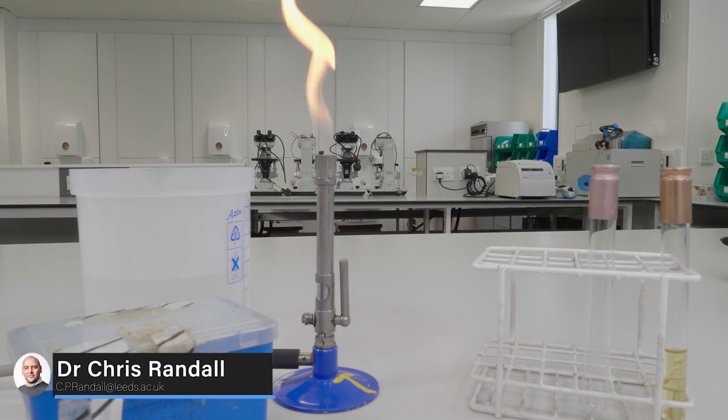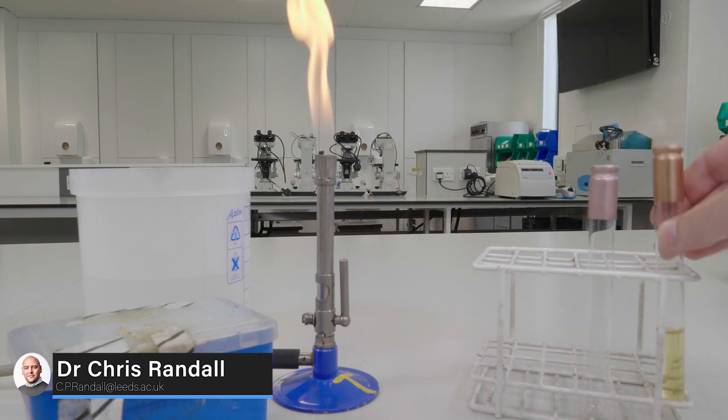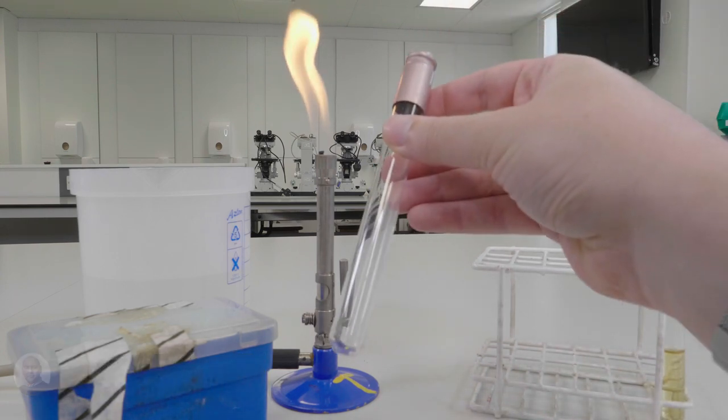In this video we are going to show you how to transfer an aliquot of sterile nutrient broth from one tube to another using aseptic technique.